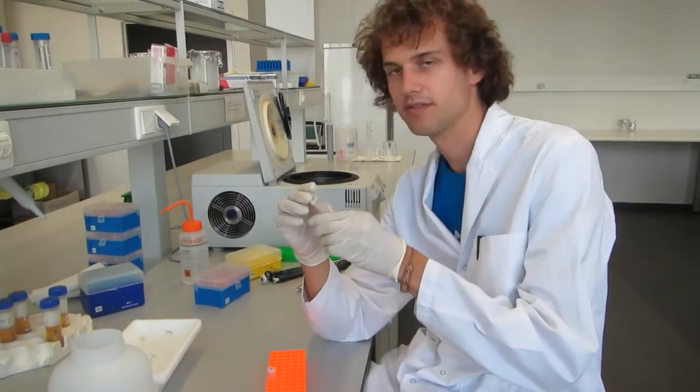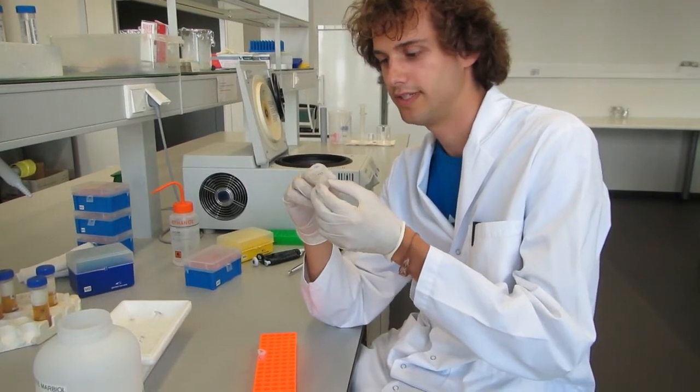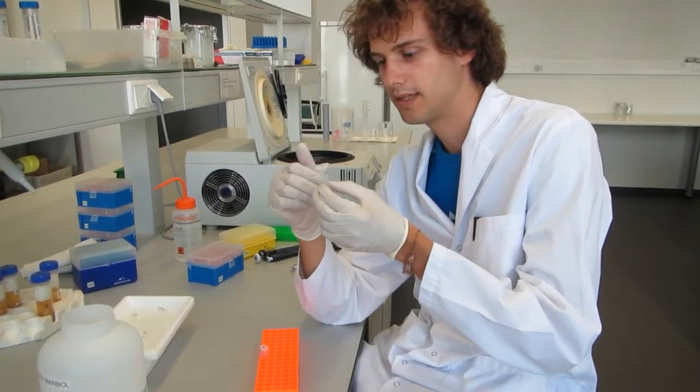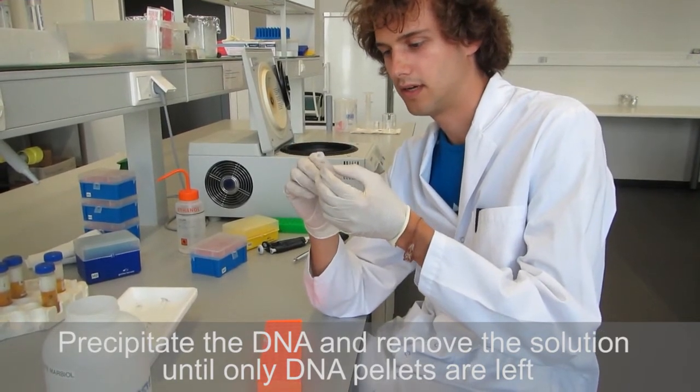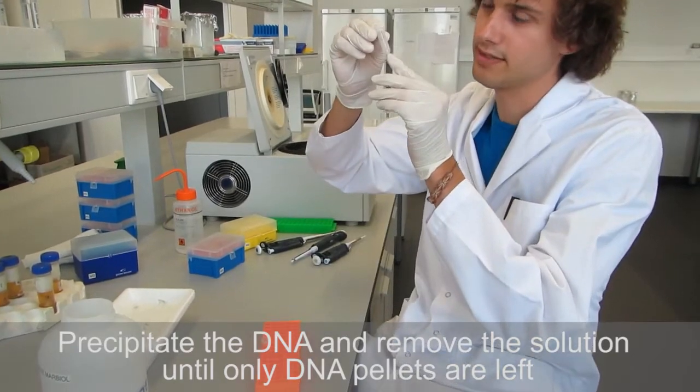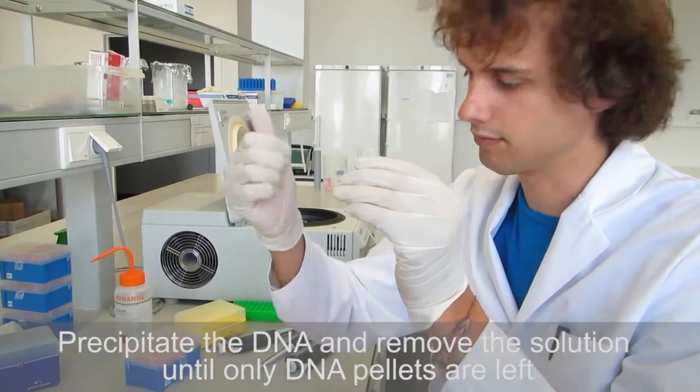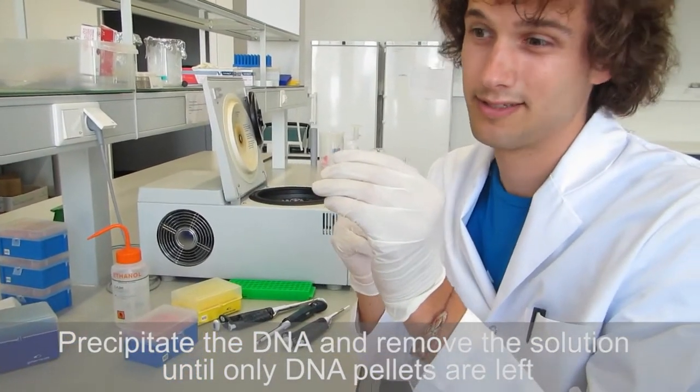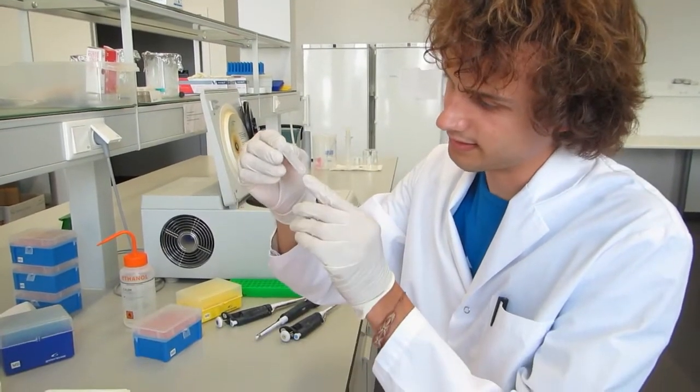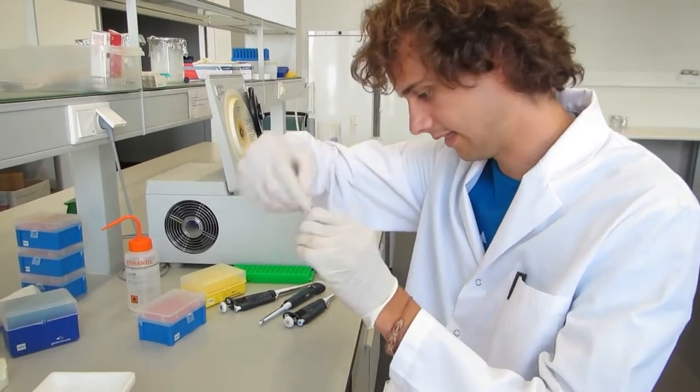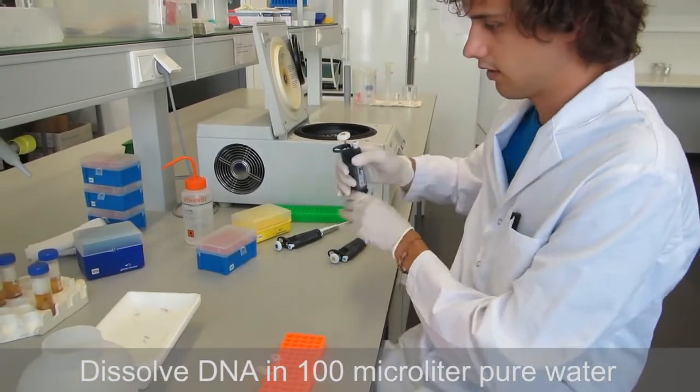We are at the end of our extractions. We precipitated the proteins, so the DNA was in solution. Then we precipitated the DNA and we removed the solution. So here we have the pellet, it's only pure DNA. So we didn't film the previous steps because it was just pipetting. It's a long work, it took us half the afternoon. Now the pellet is only DNA and we will dissolve it in 100 microliters of pure water.